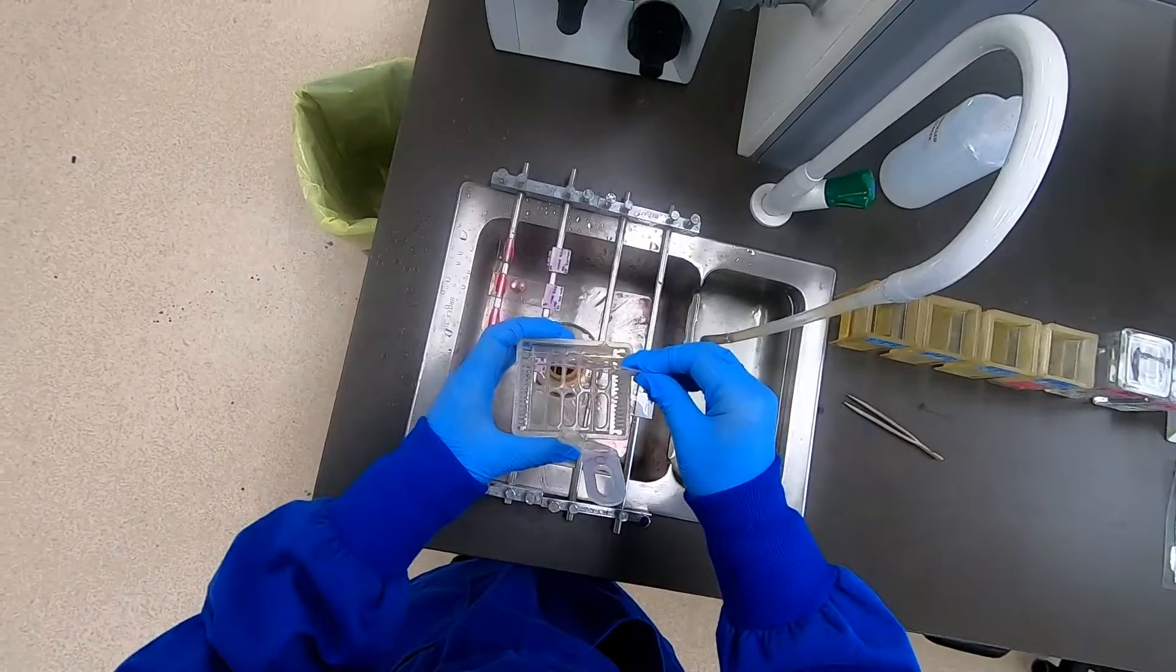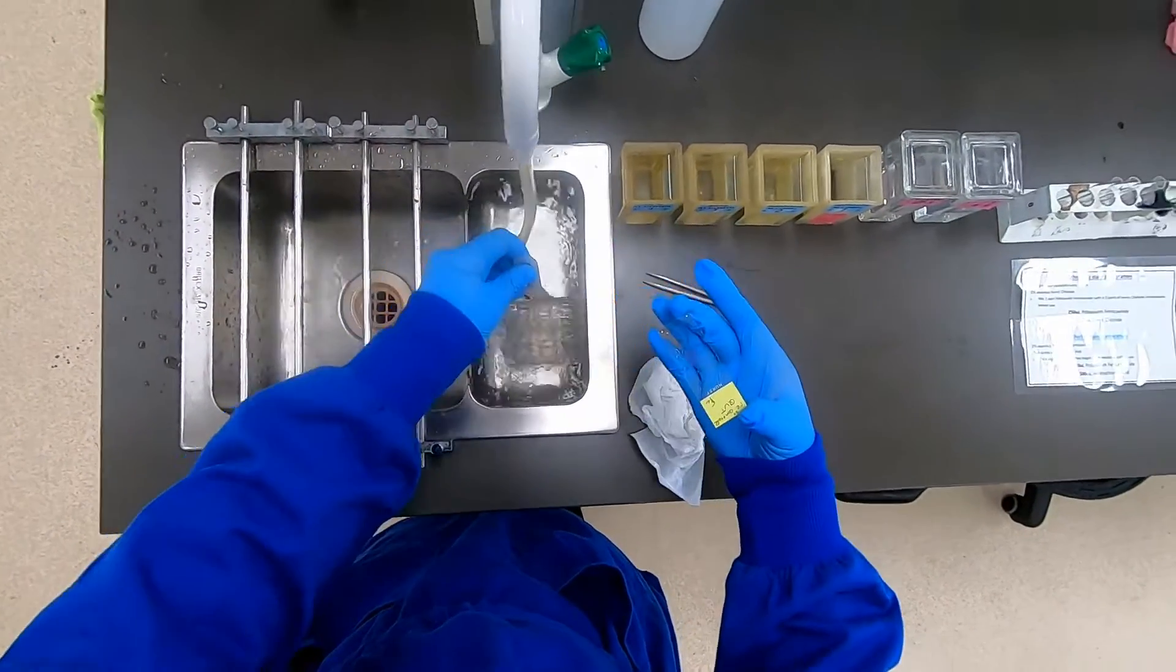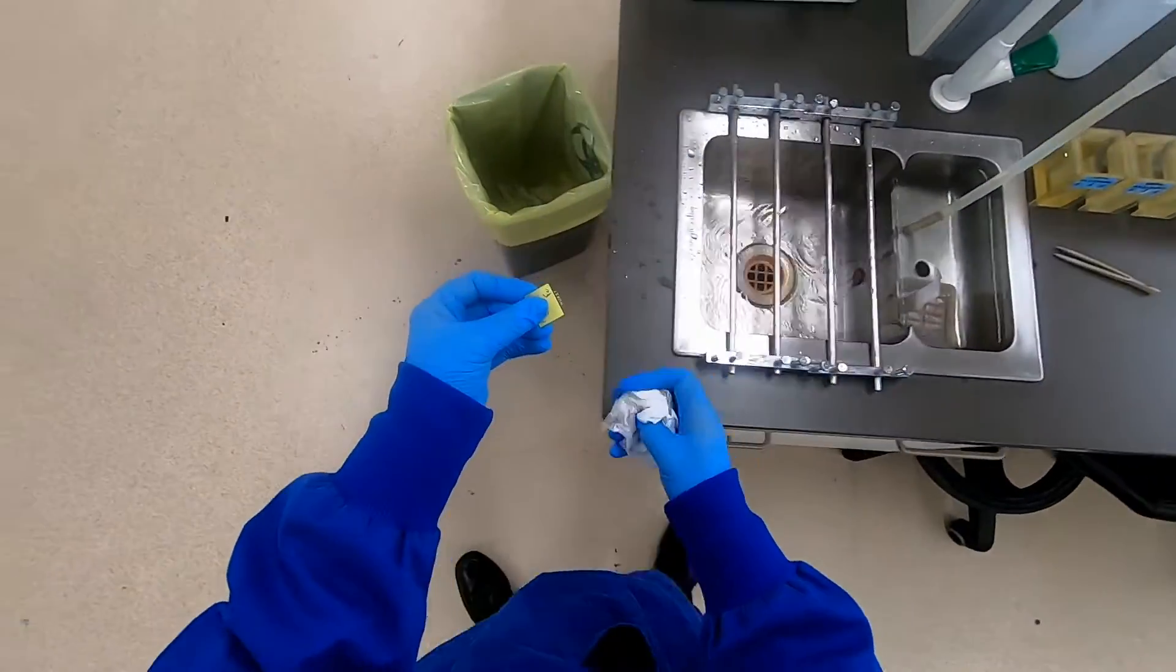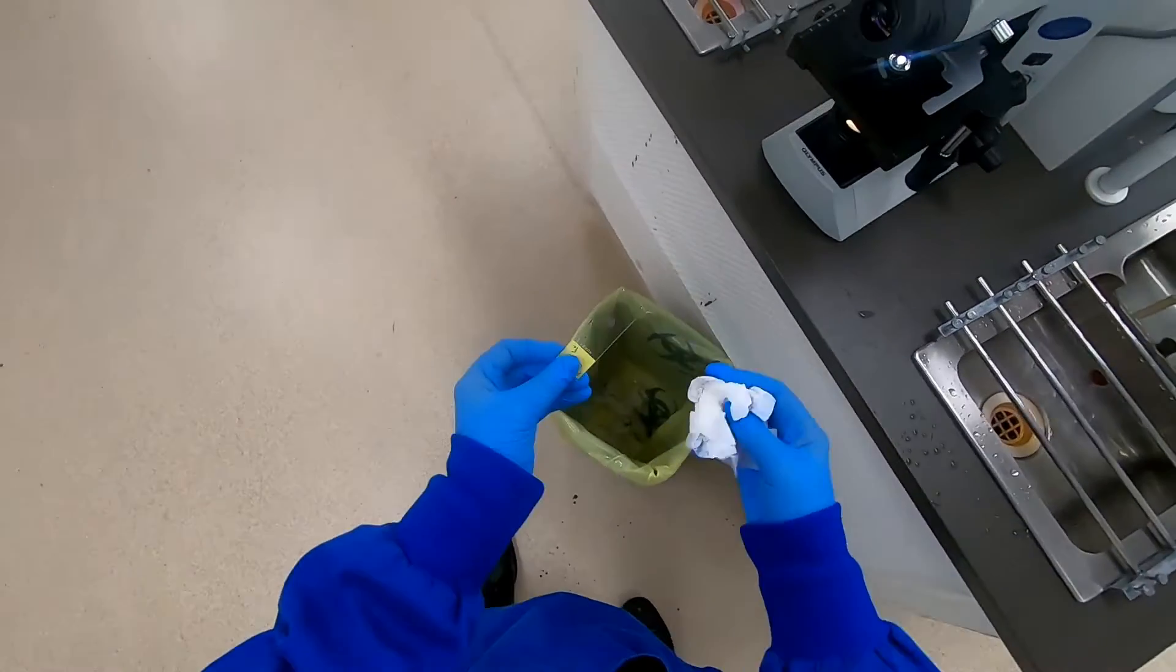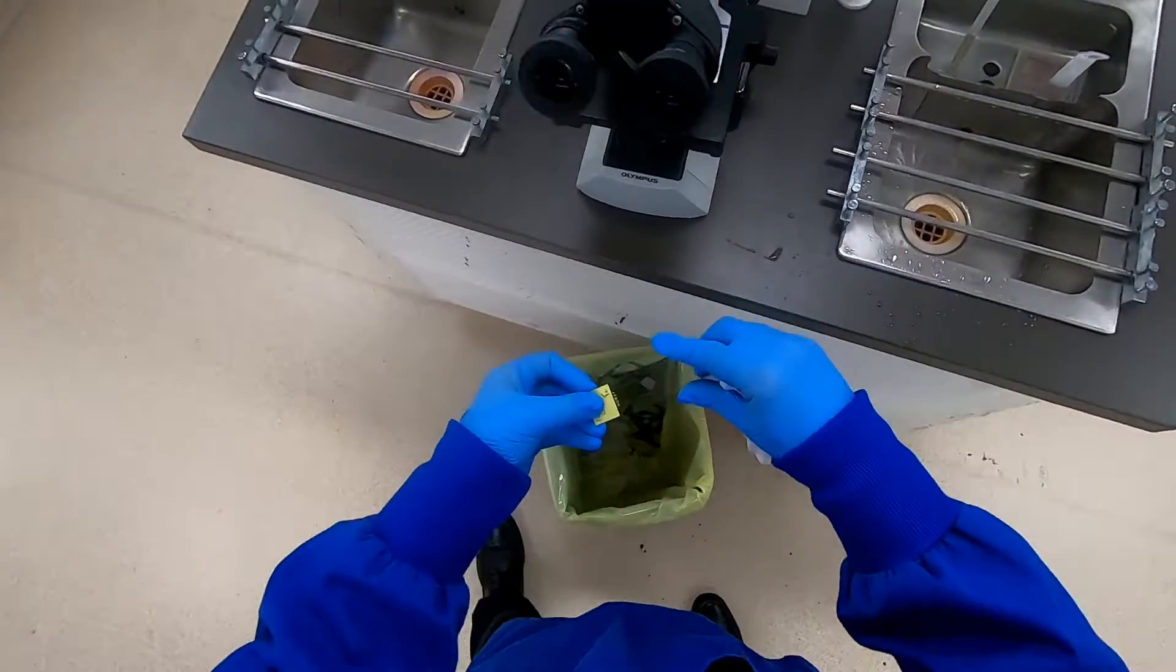You can occasionally get some precipitate of undissolved stain that can sit on the slides, and that makes it difficult to see things clearly. On this occasion though, hopefully that's been well rinsed.